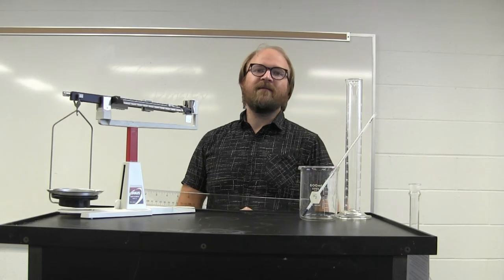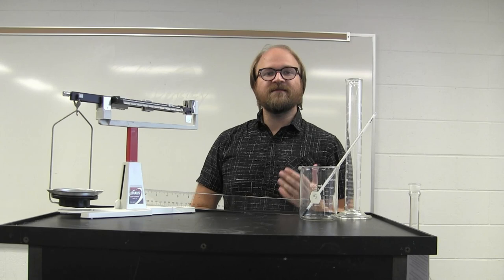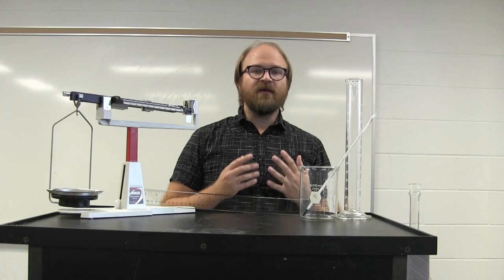In a lab setting, measurements are performed using a number of different instruments that can measure different properties. Things like mass, volume, as well as distance and temperature. Each one of these measurements has a different instrument used to measure them.